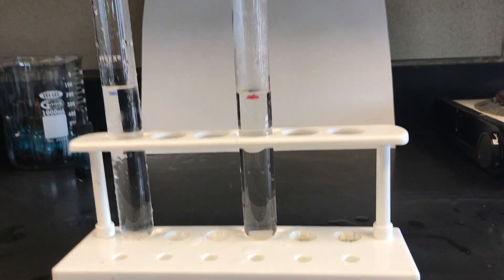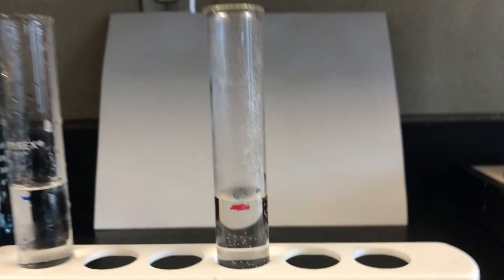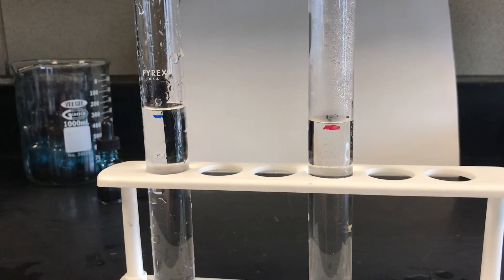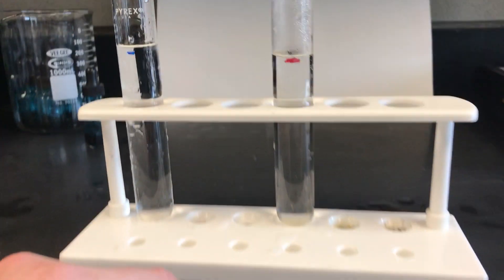That's how you set it up. You want to get these even, so if they're not even, you might want to pour out some of the cold water. Evening up with the hot water is easier than pouring out the hot water, because when I give it to you, it's going to be really hot, not like it is right now.